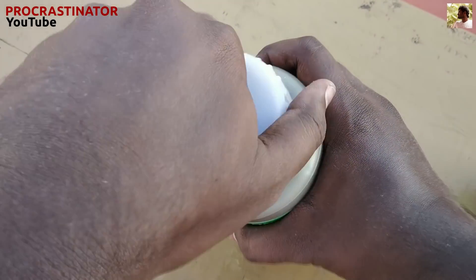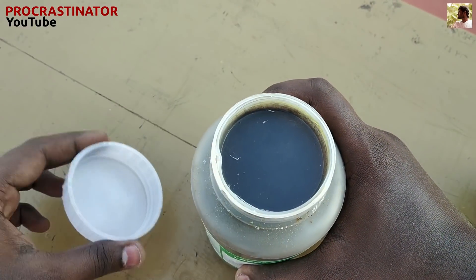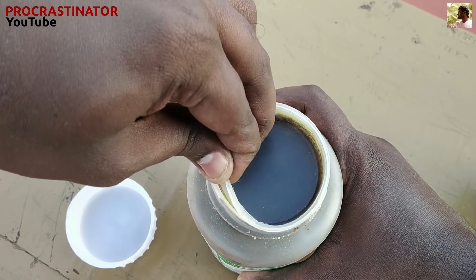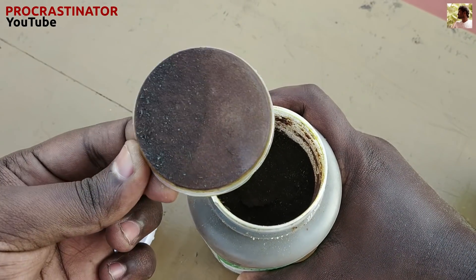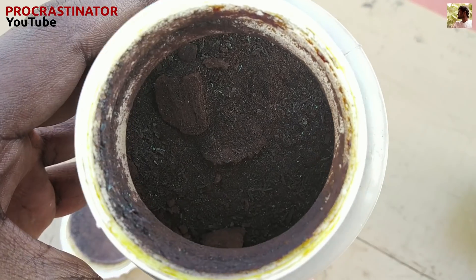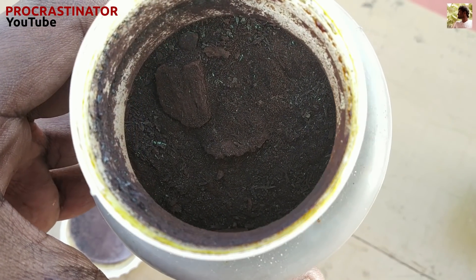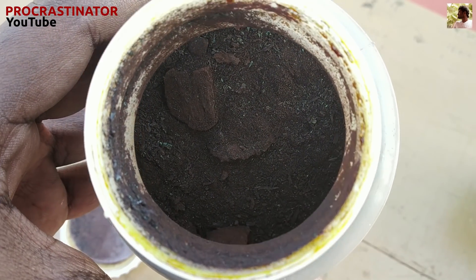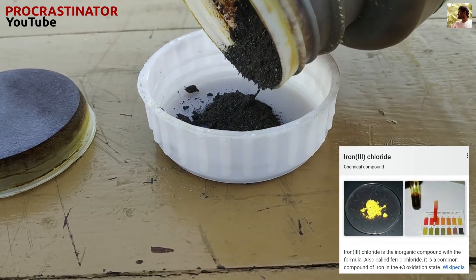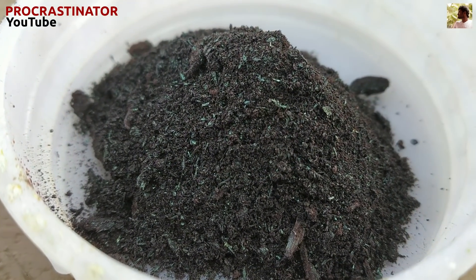Let's take a look. Let's open this one. This is ferric chloride. This is a light powder in brown color.